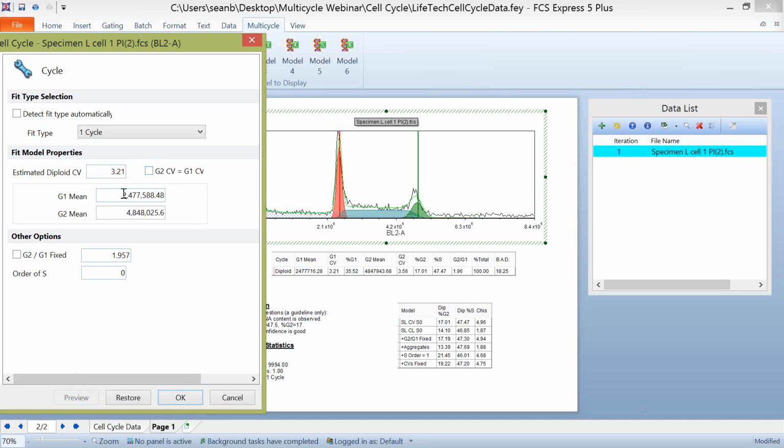Now, another important thing that multicycle needs is the G1 and G2 means. We need to know where the peak of your data is in each of these populations. When we auto-fit the data, or when you bring in data, FCS Express and Multicycle are going to make their best guess about where your G1 and G2 means are. And you can see here we've made a pretty good approximation of where those are. But if your data shifts, if it's moving around a little bit, and Multicycle isn't adequately determining where these values are, you can simply come in here and change these values.